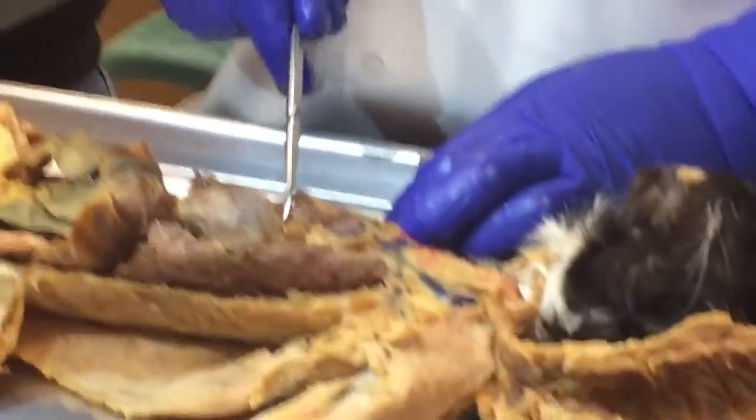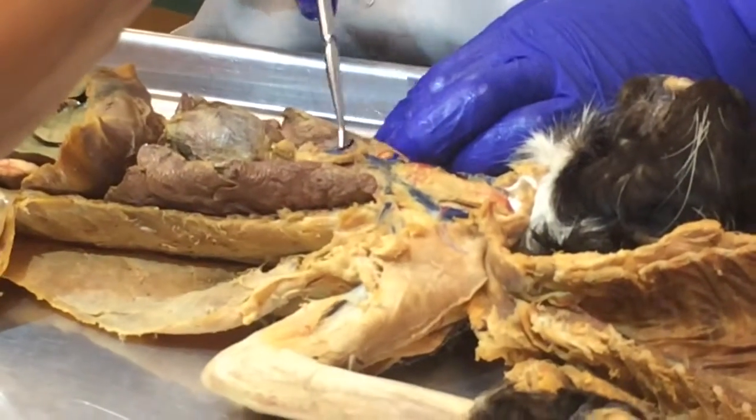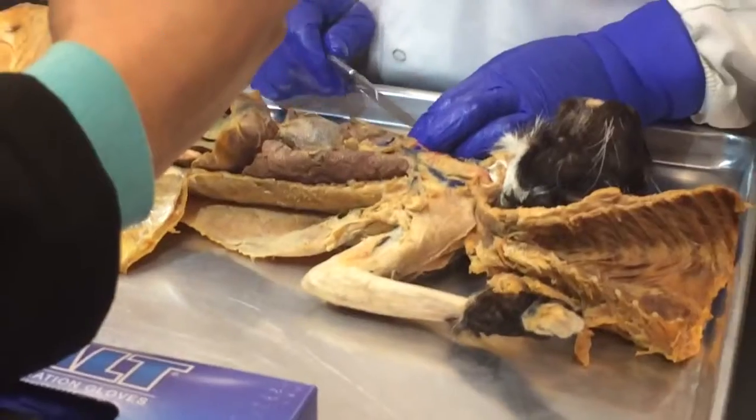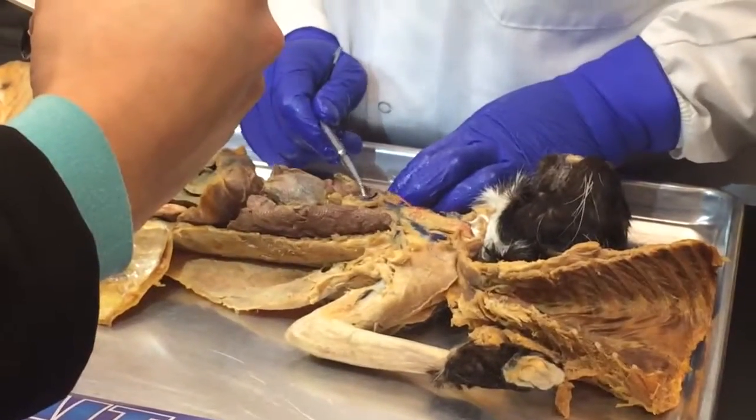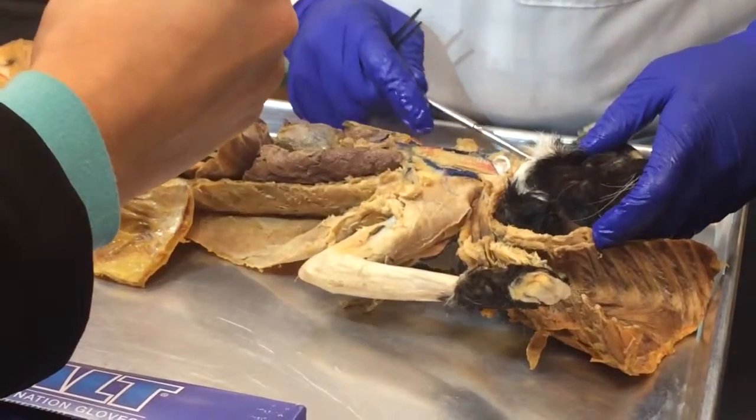So you see it, but it runs from kind of the heart, kind of over here, the trachea, and also the superior vena cava. You see the superior vena cava? And the thyroid, where would that be? And the thyroid would be up here by the thingy.